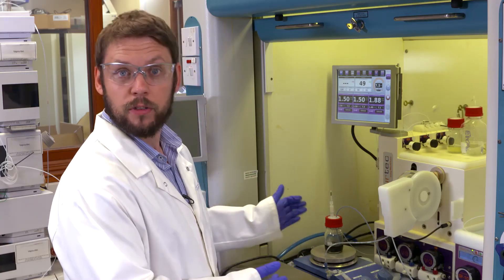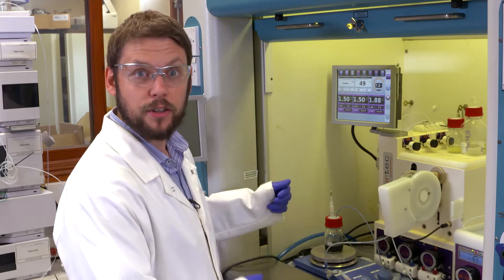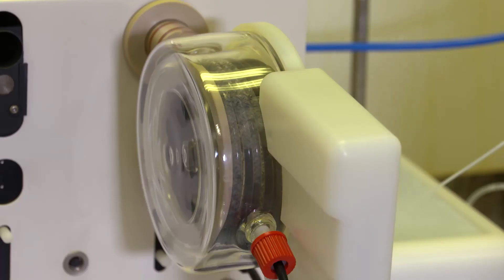So now everything's ready the system's ready to go and I can start adding in the reagent. Using the reactor for rapid mixing makes sure that this three-phase reaction is mixed thoroughly and that the reaction is able to progress without any mixing problems.